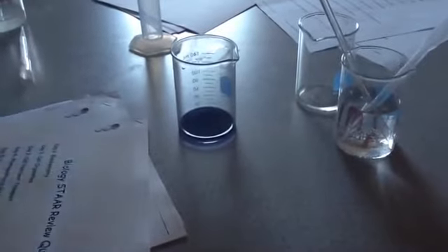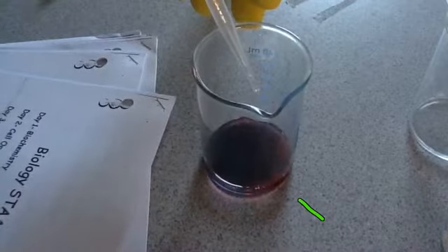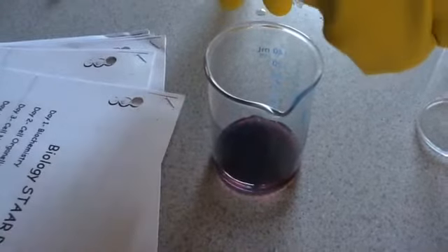As I add my acid to it, watch the color change. It's very similar to what I did yesterday. You notice here I'm adding my base first. You can actually see it getting clearer. You see a little reddish, it's a little hard to see. Right there is where you have neutralization between the acid and the base. See that red there? That's because the acid is combining with your base.